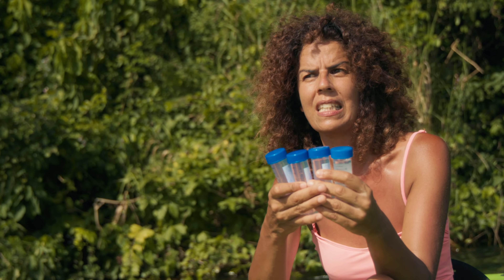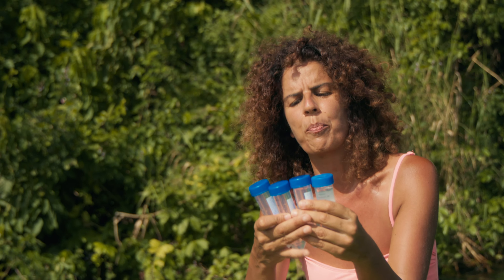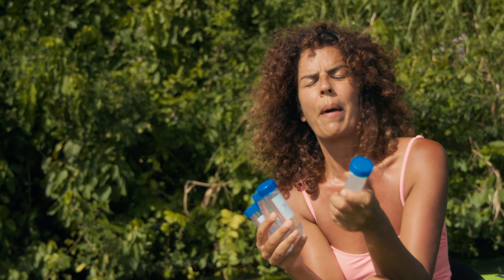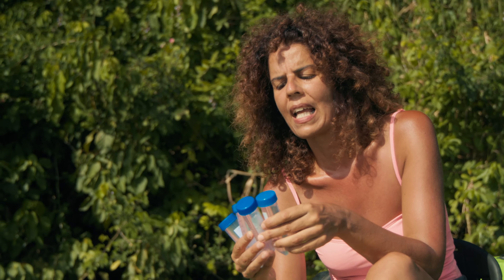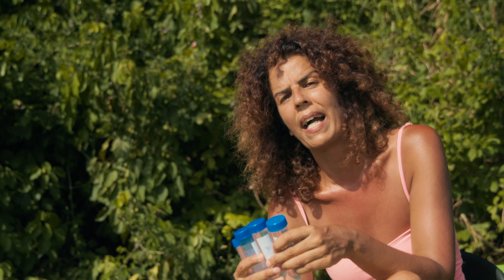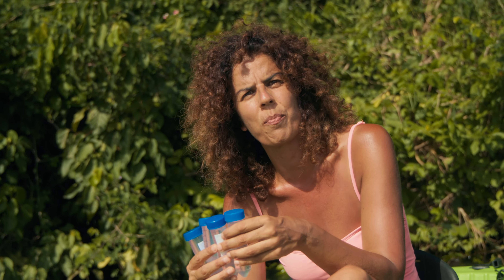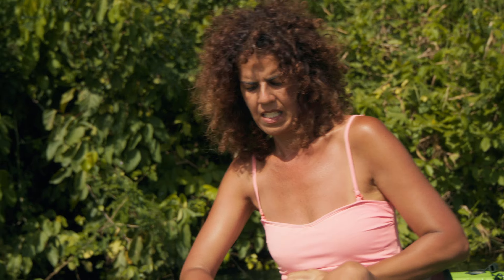Here we get information such as temperature, pH, salinity, and turbidity. We also collect additional data according to the place where we are. For example, if we are close to a factory we might collect samples for heavy metals analysis, and if we are near some villages we might collect information for bacteria.